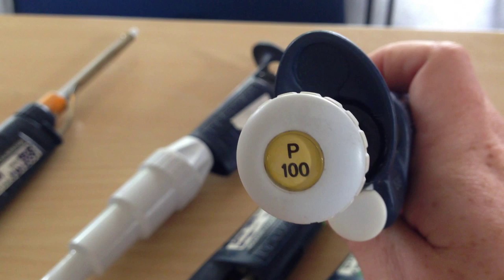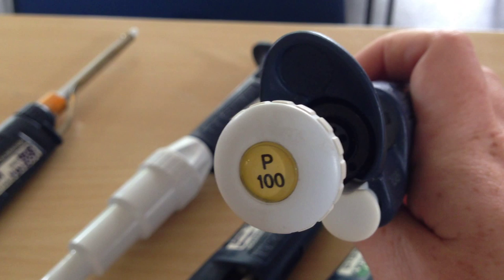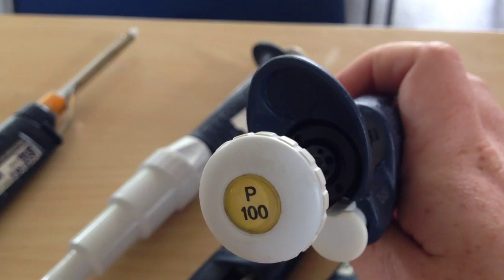The P10s we have already seen. You can get P20s as well but I don't have one here. Here we have a P100. You can use that from 10 up to 100 microliters.